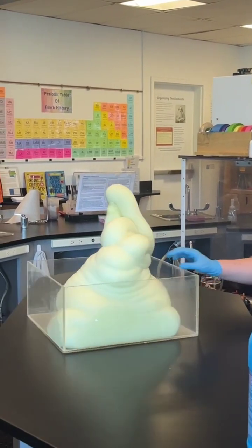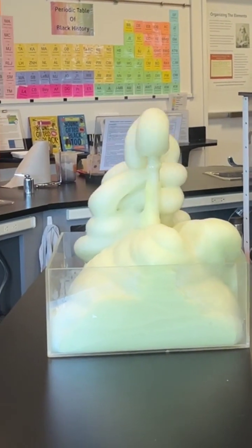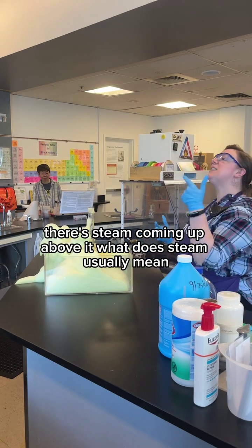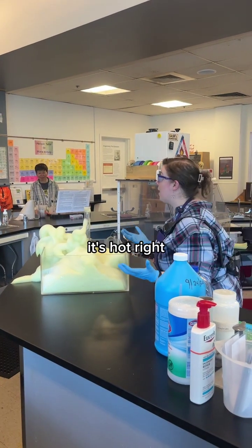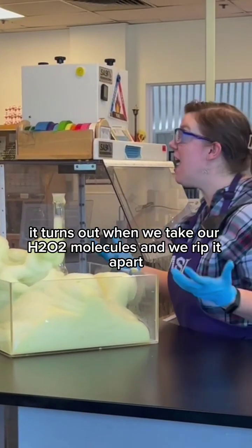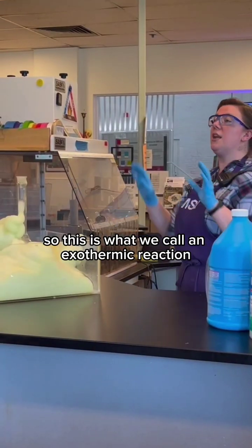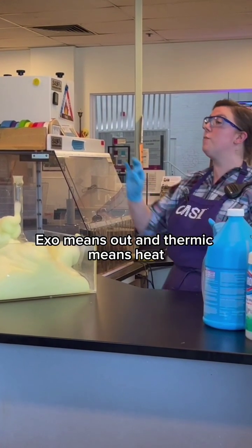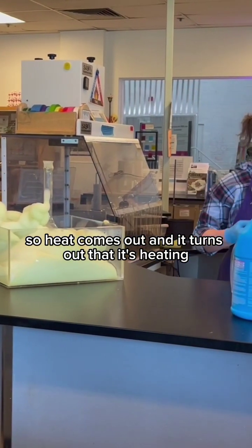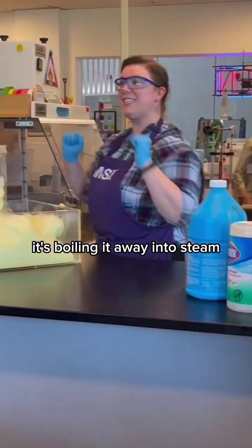There it goes! And there's steam coming up above it. What does steam usually mean? It's hot, right? It turns out when we take our H2O2 molecules and we rip them apart, it gives off a lot of energy. So this is what we call an exothermic reaction. Exo means out and thermic means heat. So heat comes out. And it turns out that it's heating the water that we just made in that experiment. It's boiling it away into steam.